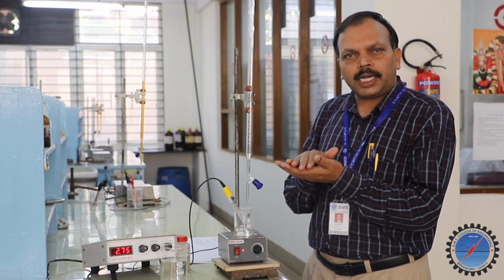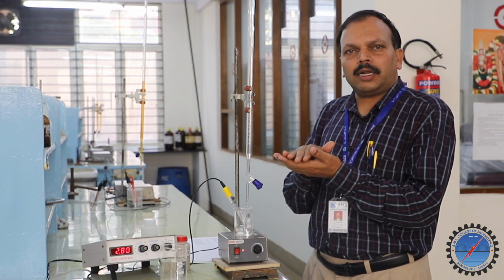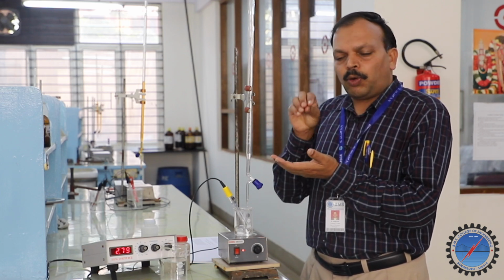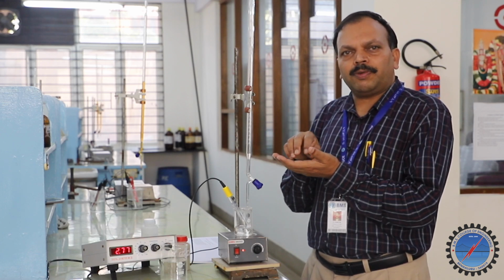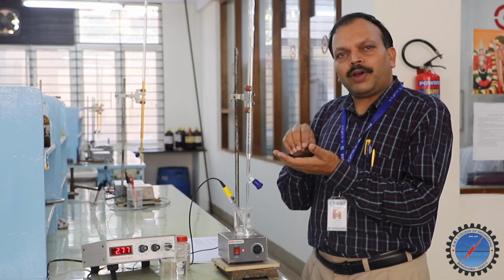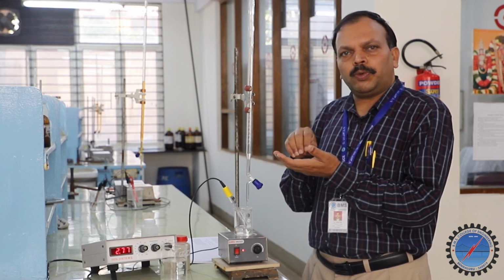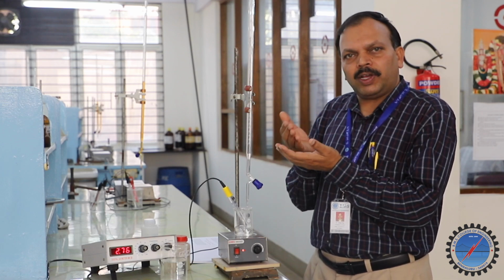We are not going to get a delta pH value for zero addition, or without any addition of sodium hydroxide. That is the beginning reading. So we will get the delta pH value from 0.5. I will tell you how we are going to record it. From 0.5 onwards, for 0.5, for 1, for 1.5, for 2, 2.5, we can get delta pH by subtracting the previous reading.